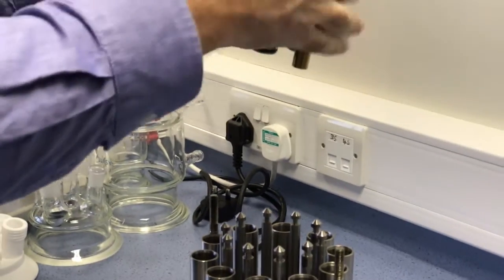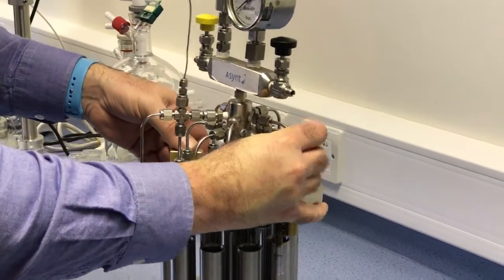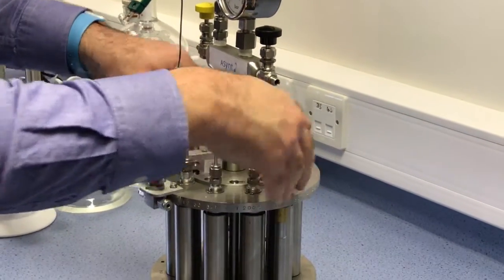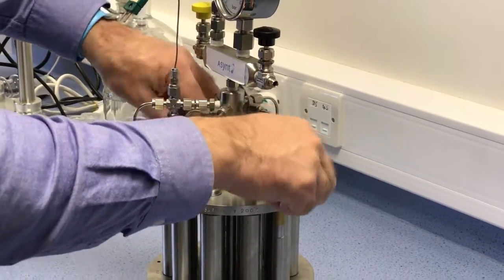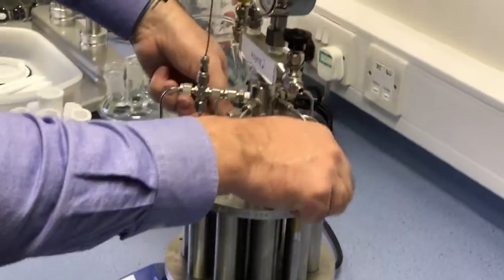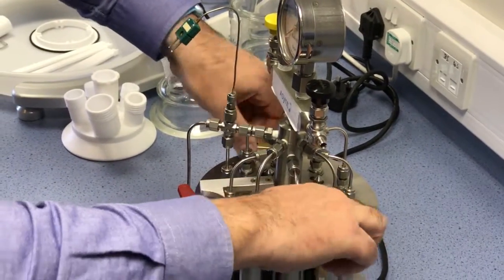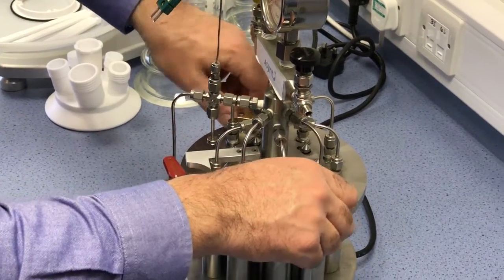So let's put it back together and I'll show you how to carefully put it into position that it could be used safely under pressure. So just winding these down all the way until we can't turn them anymore. OK, so they're both fully wound down.